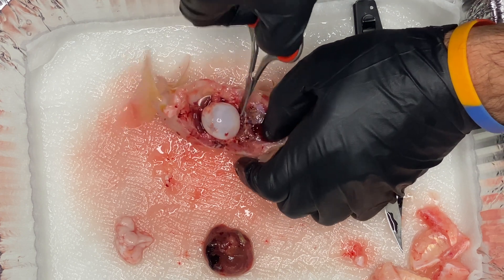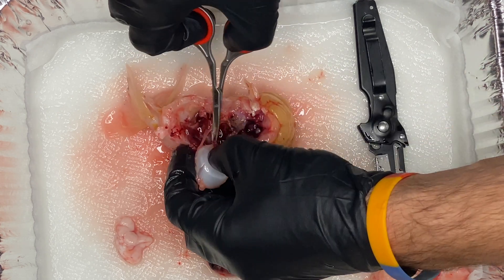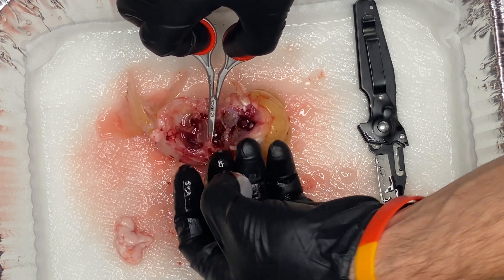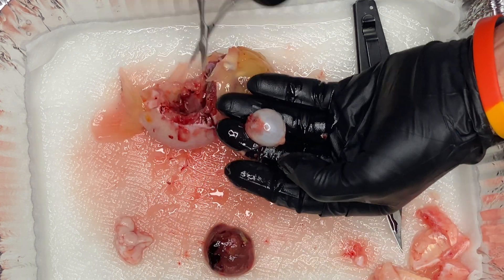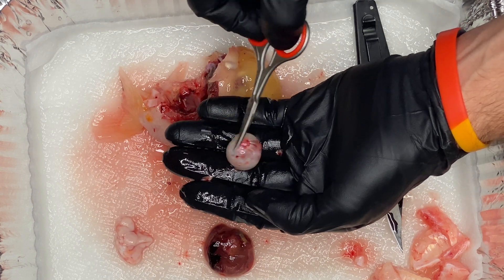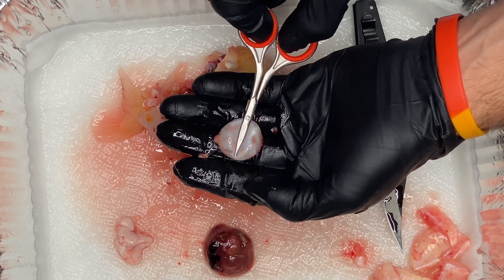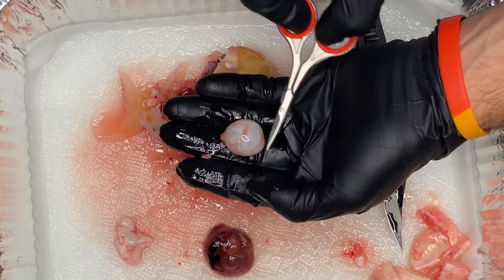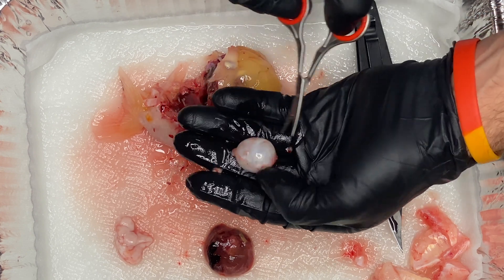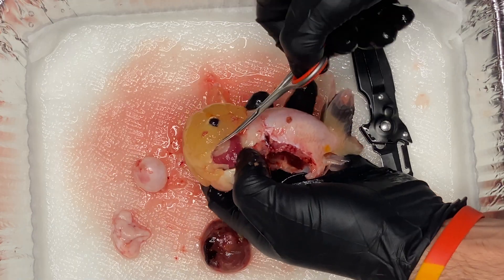Right here I am cutting out the swim bladder, and the swim bladder basically has one main connection point. I'm not a professional, but I'm assuming this is where they're able to swallow air and inflate the swim bladder manually — because goldfish can do that, they can swallow air and actually inflate their swim bladder. They do that when they're little. I'm assuming that one connection point where I just cut is where basically air has access to get in. I think there might be one more connection point in the back, but it was really hard to tell with all the connective tissue.